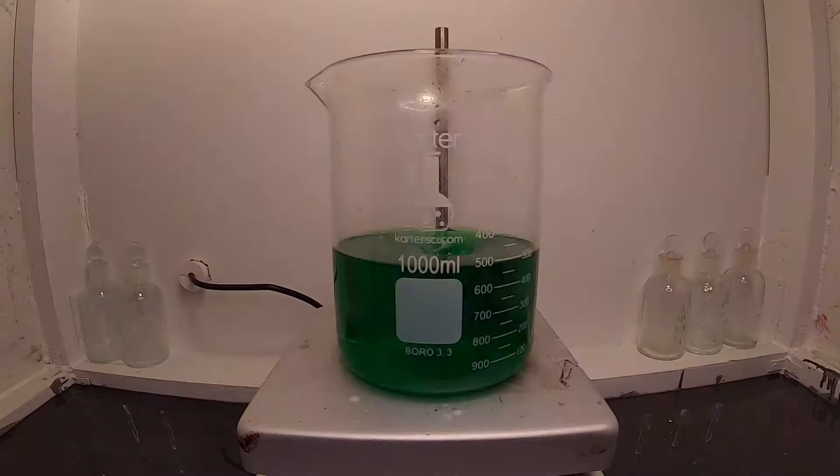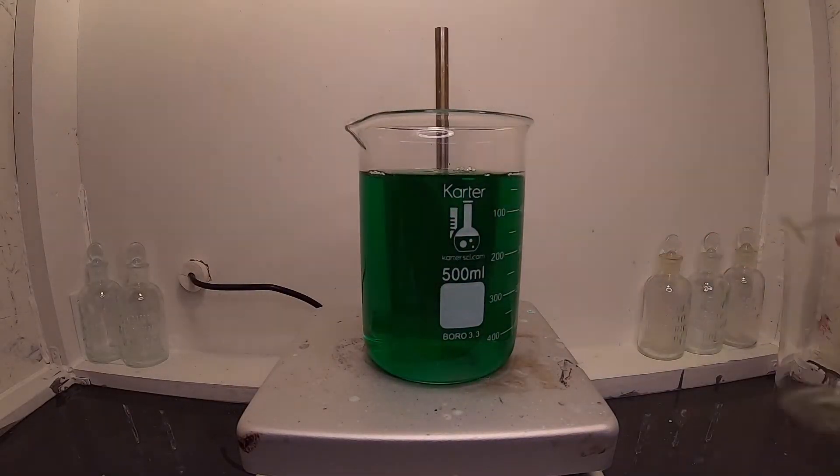This has converted the copper carbonate into copper chloride, which is soluble in water.